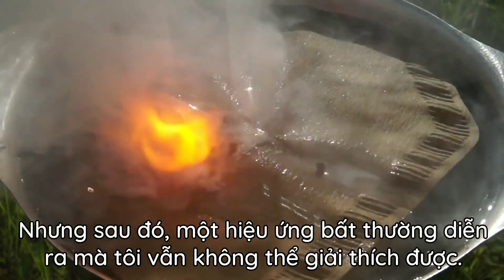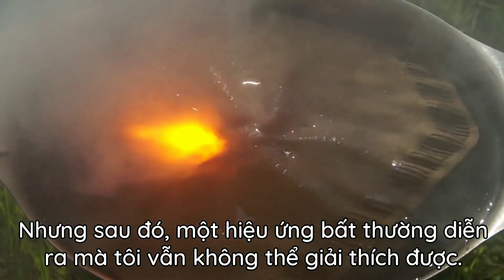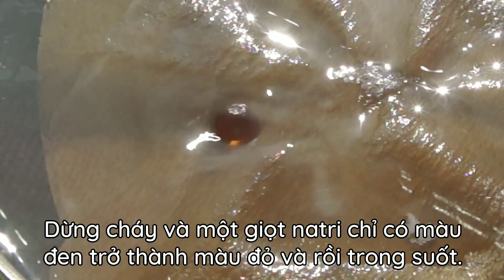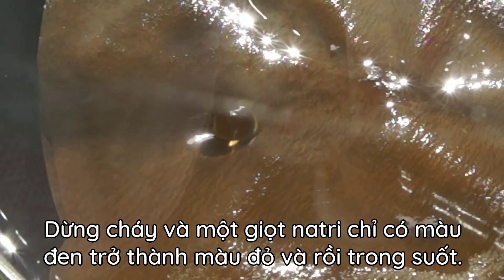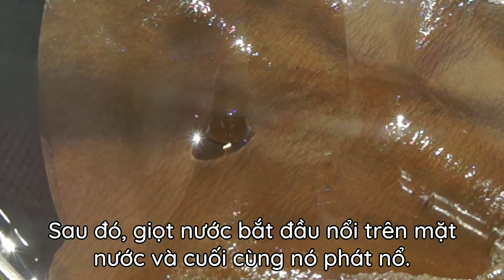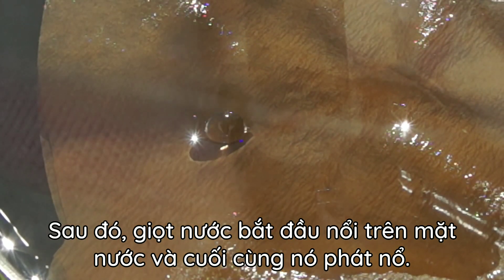But after this, an unusual effect takes place, which I still cannot explain. Burning stops, and a droplet of sodium that was just blackened becomes red and then transparent. After that, the droplet begins to float on the water surface, and in the end it explodes.